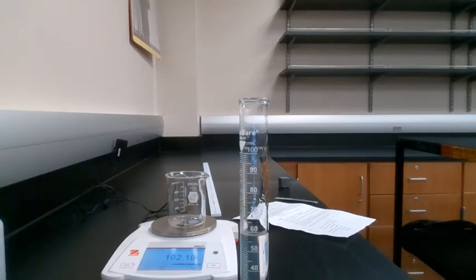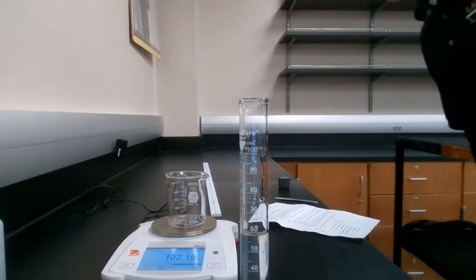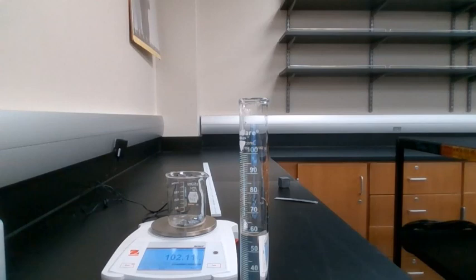Your next step after you make that measurement is you're going to want to take the final volume of our sample of water minus that initial volume, and that is going to give us what our volume of metal is. Pretty cool. And you're going to record that in your data table, as long as you look up what the atomic number for silicon is and record that in the data table as well. Next, you're going to answer the rest of those questions on your lab sheet.